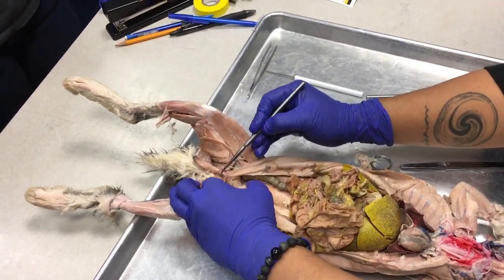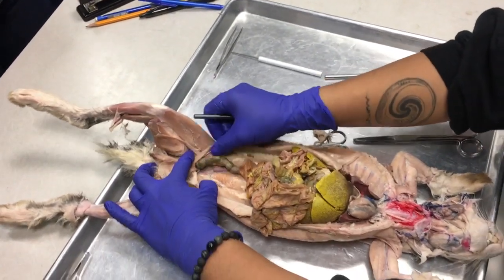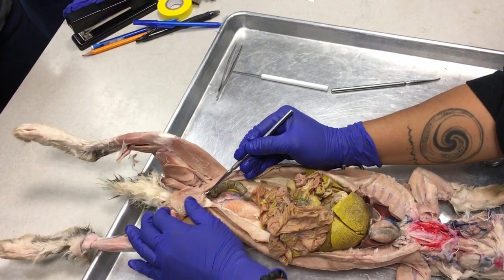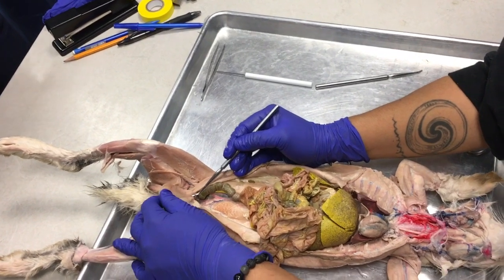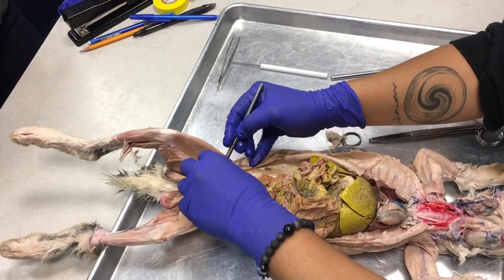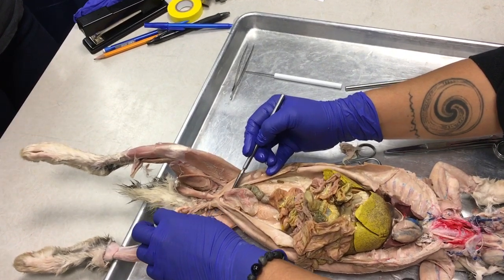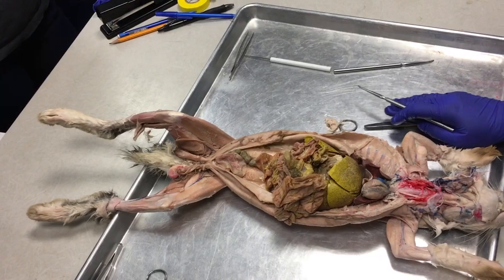So if I peel up on the urinary bladder here, I can see where the vas is entering the urethra underneath. So see, I can pull on the spermatic cord, and that's evidence that it's connected to the outside. Okay? So, go.